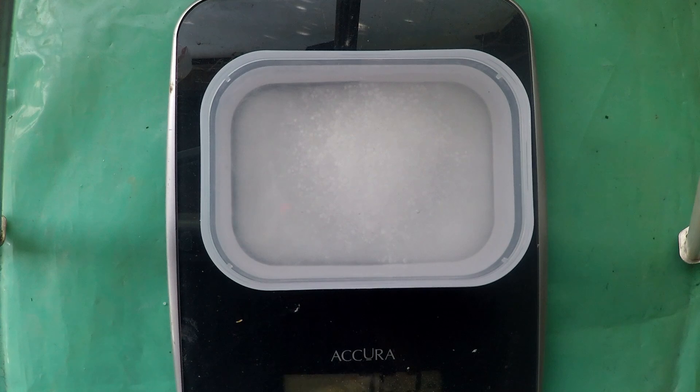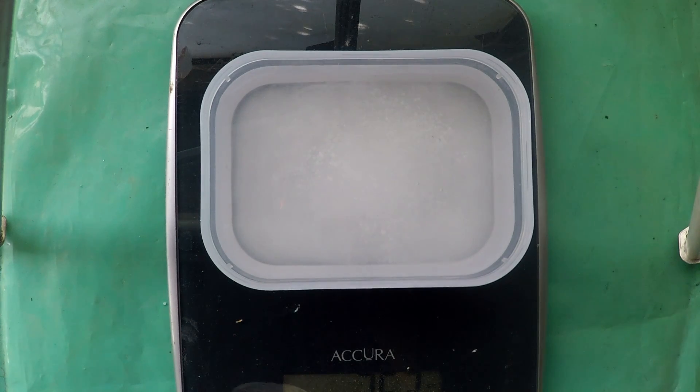That's close enough and I'll just put some gloves on before I get carried away anymore because now we've got the caustic solution and it is quite corrosive, it will attack your skin. It's very hard to rinse off you always wind up with this terrible slimy feeling on your hands.